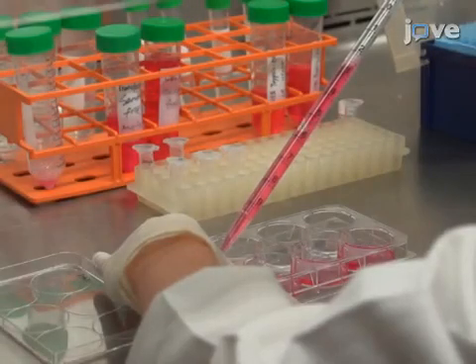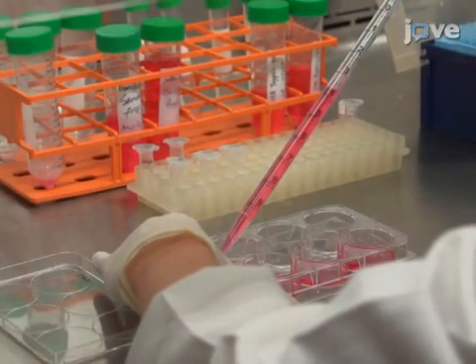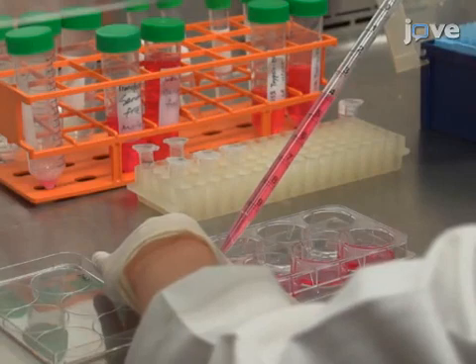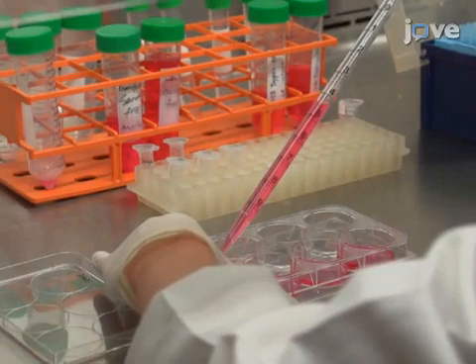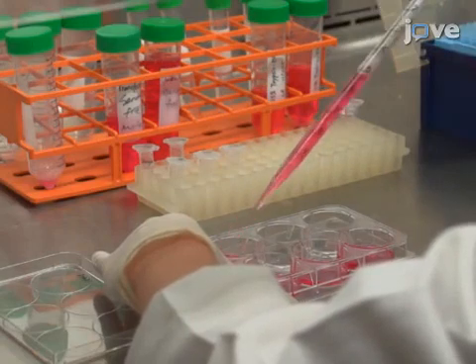24 hours before their transfection, plate 7 x 10⁵ C2C12 cells per well in a 6-well plate.